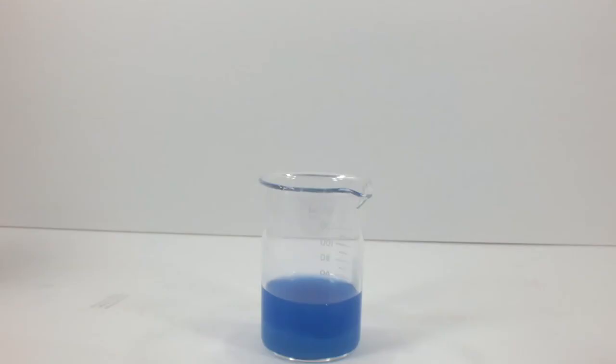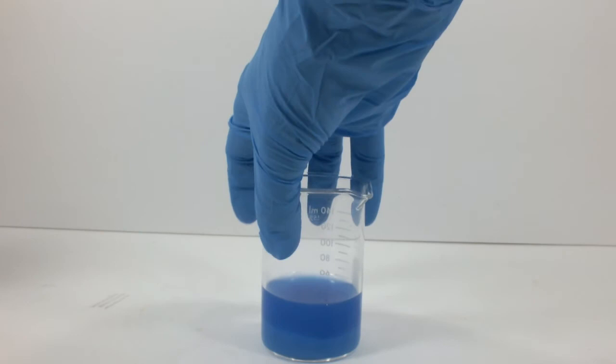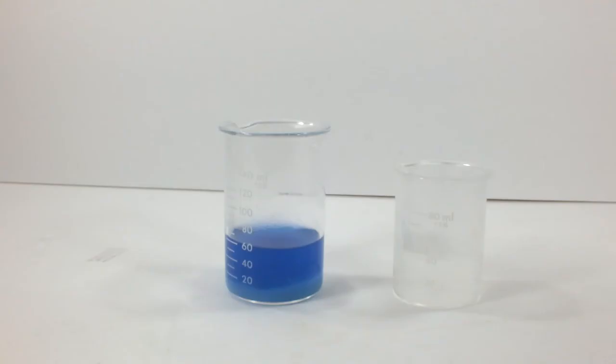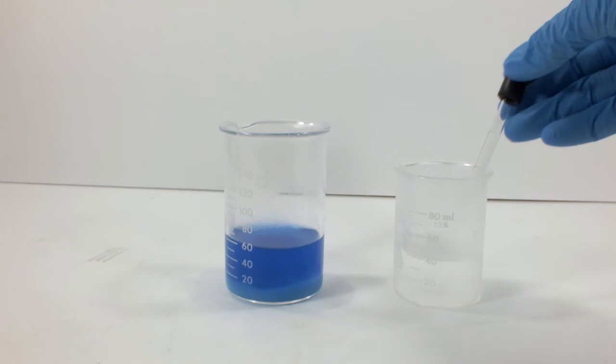This is after the first refrigeration, before adding the acetone, and there's already some solid precipitate. I decided to add the acetone anyway and see what happens. In an unprecedented show of restraint, I added acetone dropwise to the solution. And nothing happened.